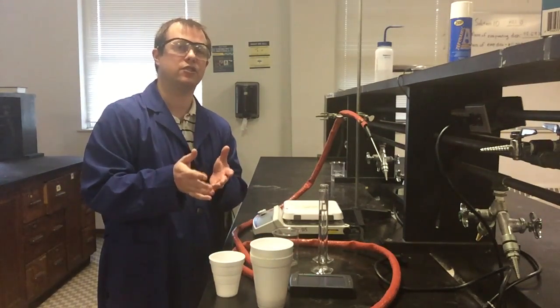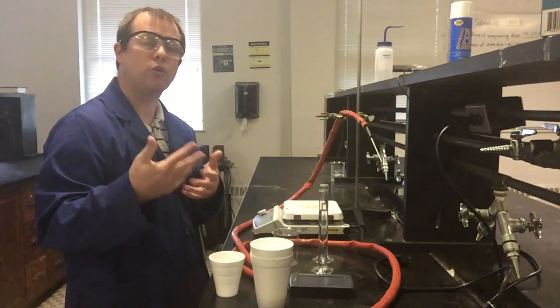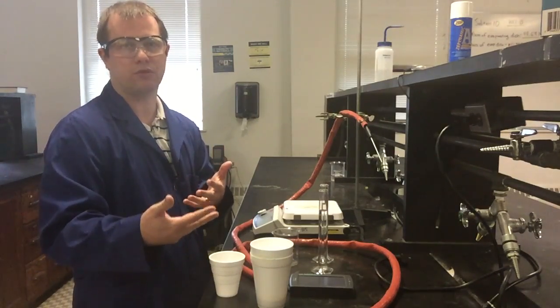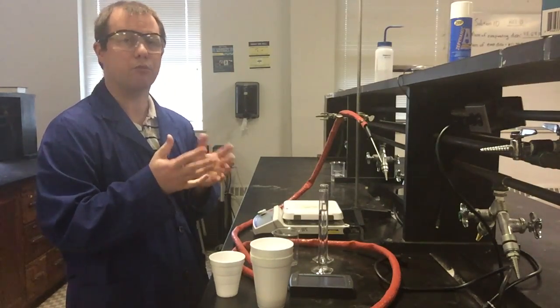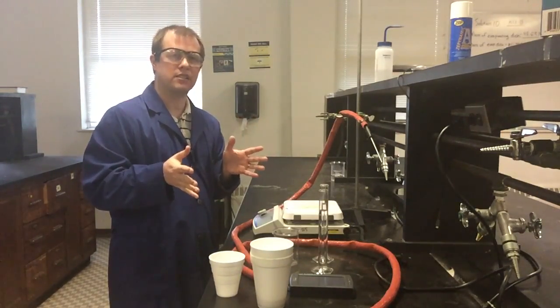What we're basically going to try to do from this part of the experiment is figure out how much heat this cup and just the general surroundings are going to normally absorb as we mix hot and cold water. That'll give us an idea of the calorimeter constant that we can use and treat in the second part of our experiment, when we go to figure out how much energy our neutralization reaction will release and we actually react the acid and base in that portion. So those are going to be the two main parts of our experiment. I'm going to show some quick setup things here.